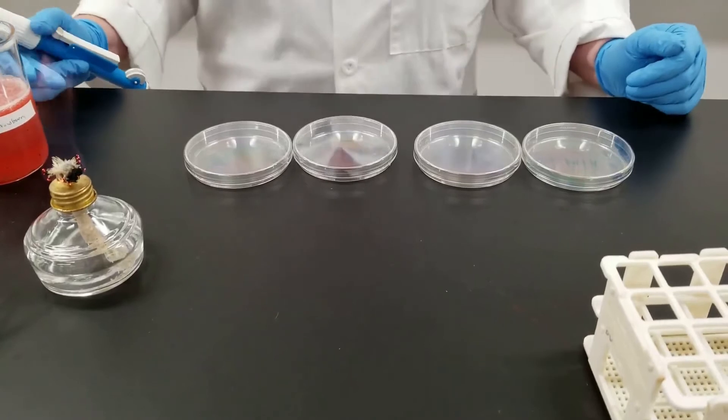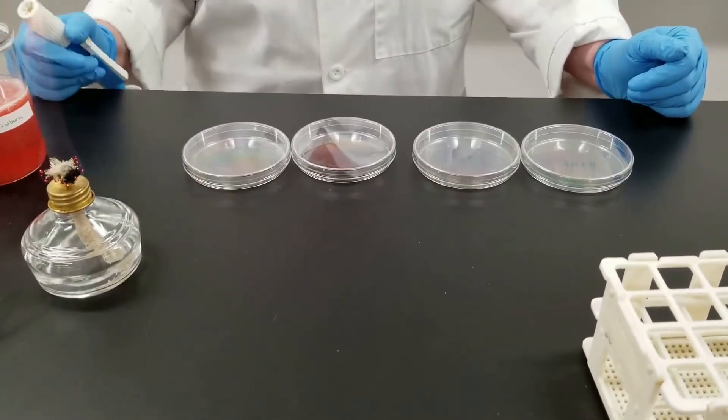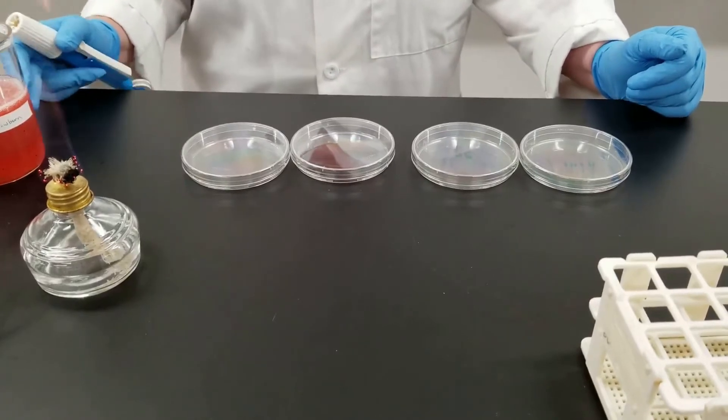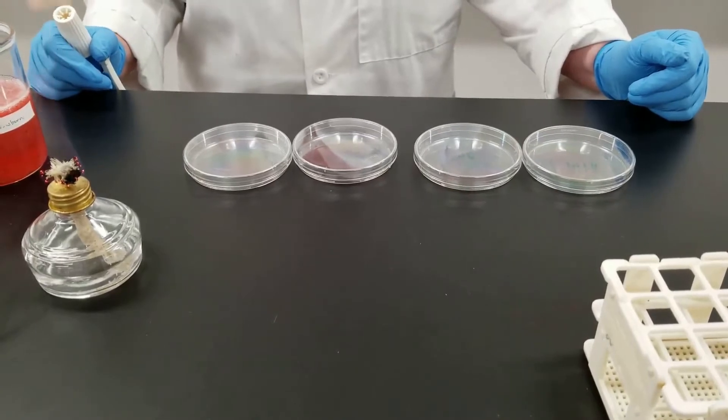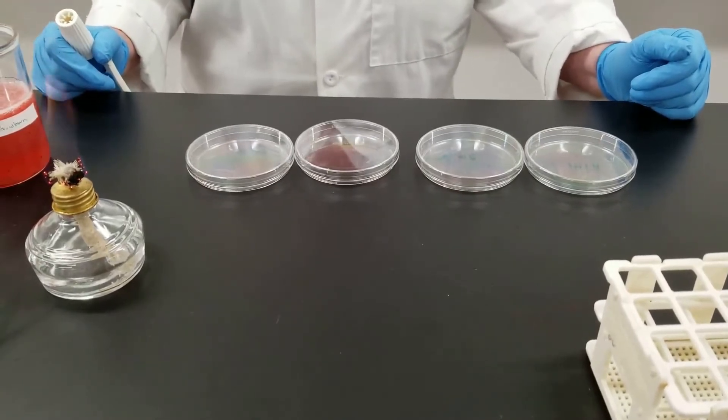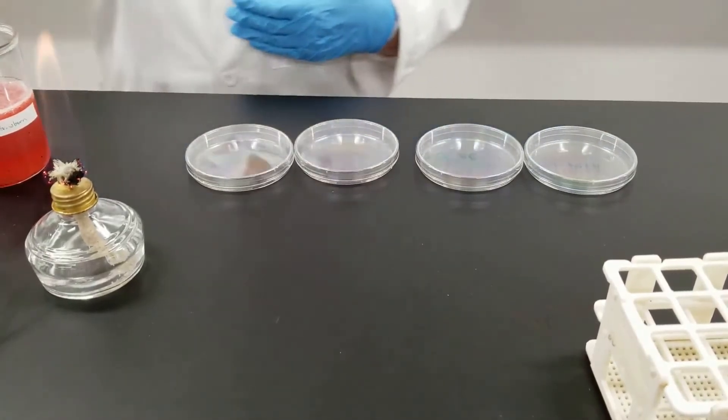We weighed them, mixed them in with water, and so we are now going to take this diluted strawberry slushy, if you will. The ultimate purpose is to figure out how many bacteria are present per gram of strawberry - how contaminated, if it is contaminated.